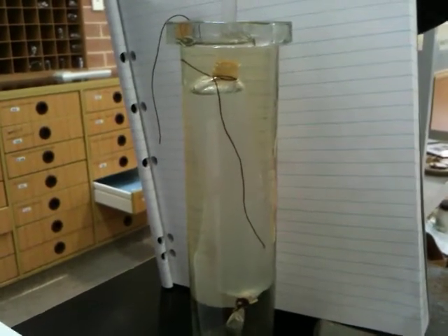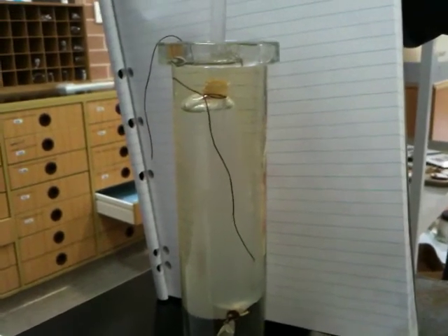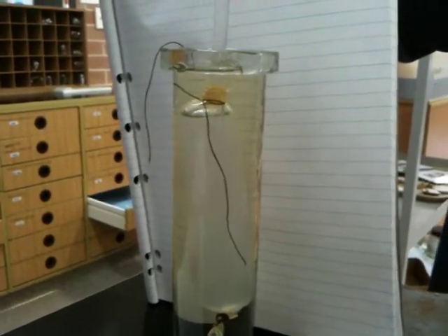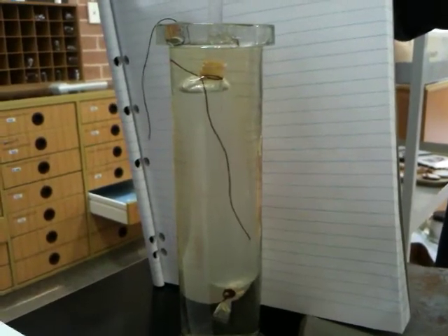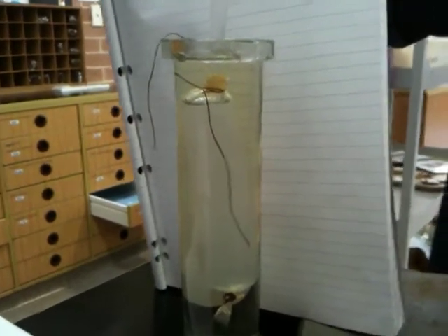And so what is that? What is that chemical? What does it do? What are we trying to indicate? Trying to indicate that it's going to enter through the semi-permeable bag, the iodine will, and when it comes in contact with the starch, it'll change colour. Good, so it'll change to that blue-black.